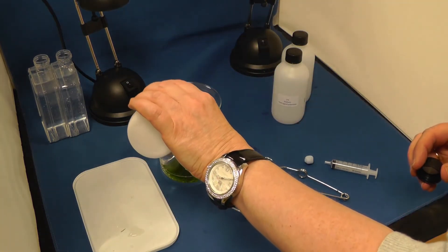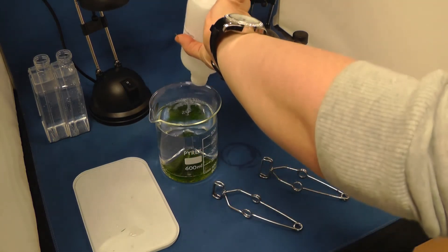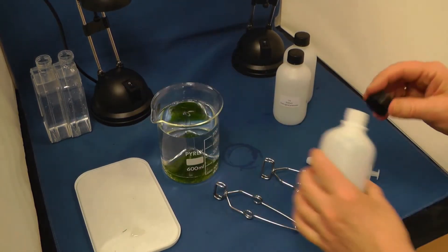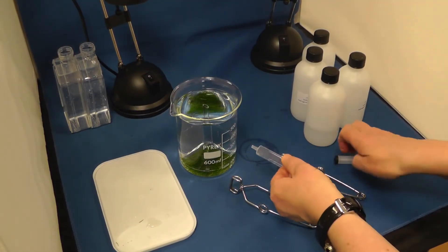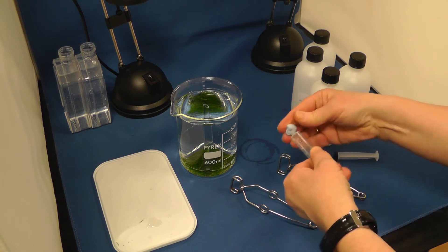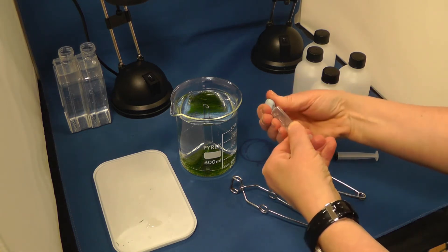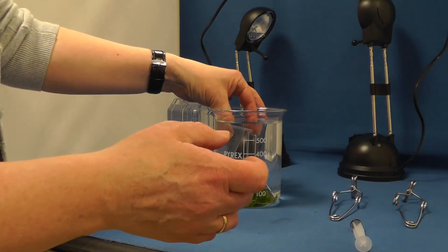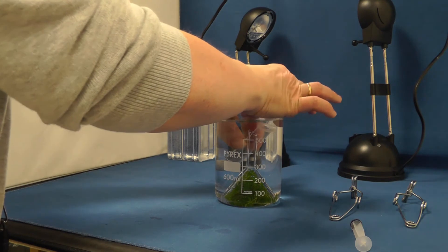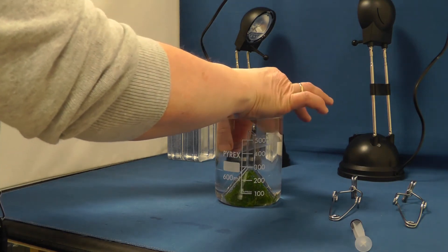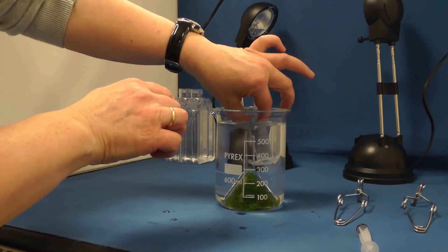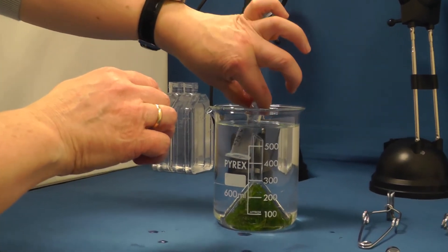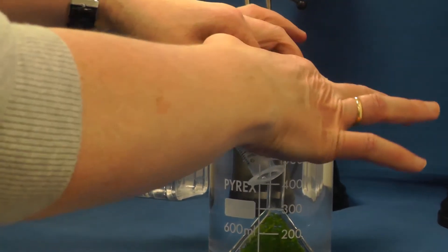You will need enough sodium hydrogen carbonate to cover the end of the stem of the funnel. Fill the syringe with the solution and turn it upside down under the level of the liquid. This will place it over the end of the funnel.